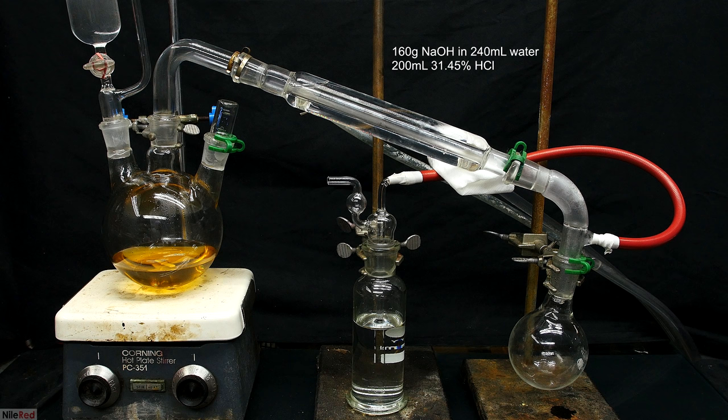Also, it should be noted that up until this point, there's absolutely no stench, because we directly made trimethylamine hydrochloride. The trimethylamine hydrochloride is a salted version of trimethylamine, and it doesn't really have very much of a smell, but in this next step, we're going to be freebasing it. The trimethylamine has a very strong fish odor, and it will almost definitely leave its mark on the work area.